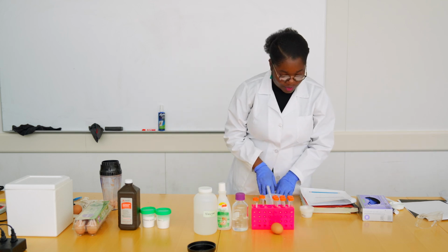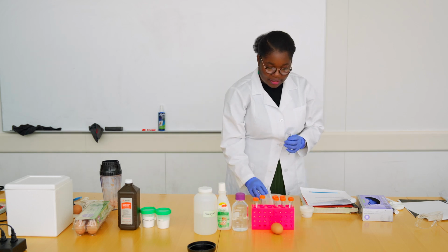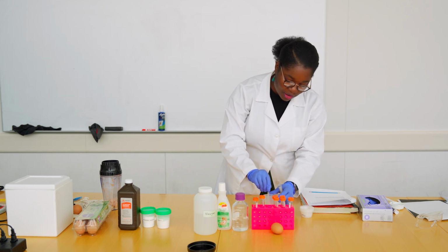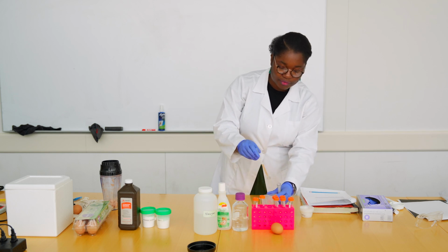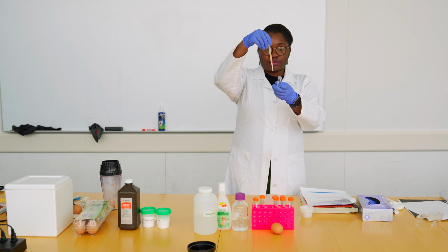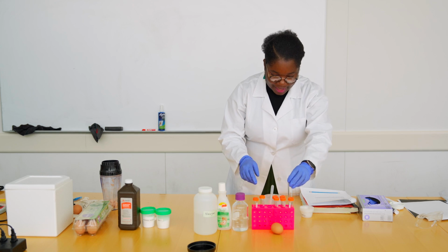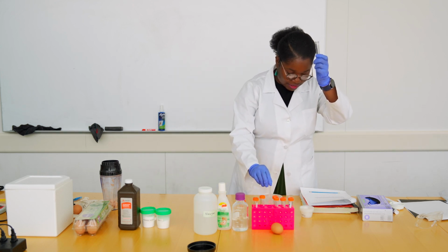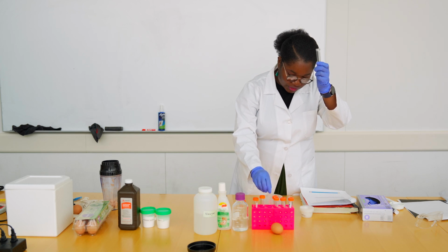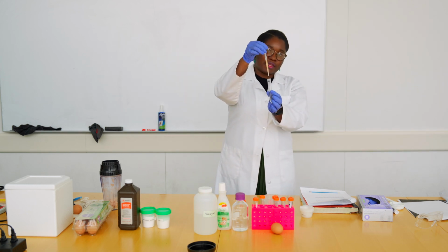And so what we are going to do, we have our first test tube that we are going to introduce about 10 drops of potato juice. So I'm measuring again with my trusty pipette, as I showed you earlier. 10 drops, or about 1 ml, of our potato juice. And we add, again, 10 drops of the potato juice in the control catalase. You can still use the same pipette because you're not putting that pipette in any other thing.